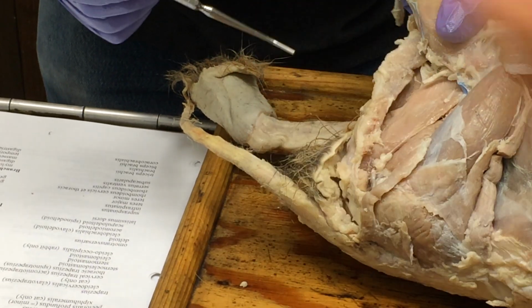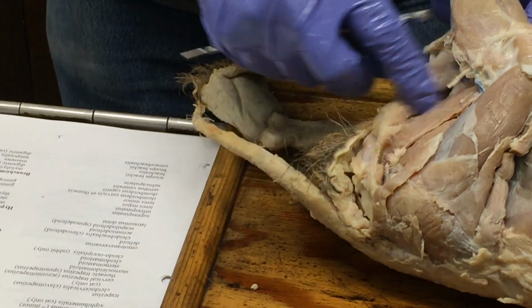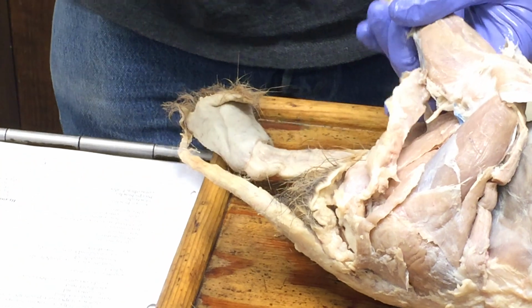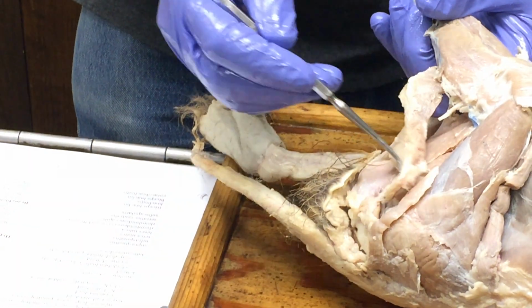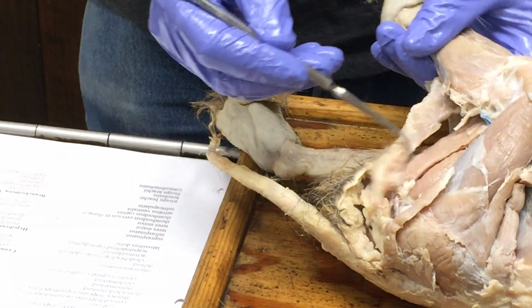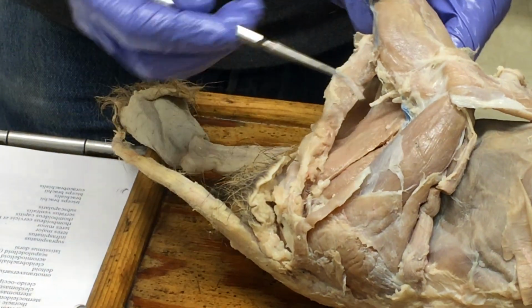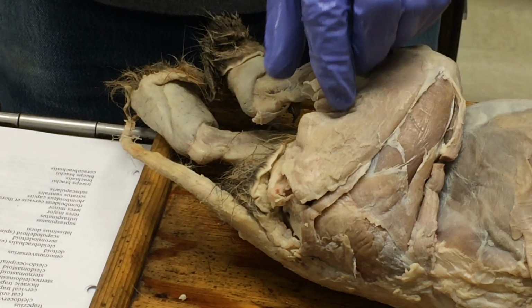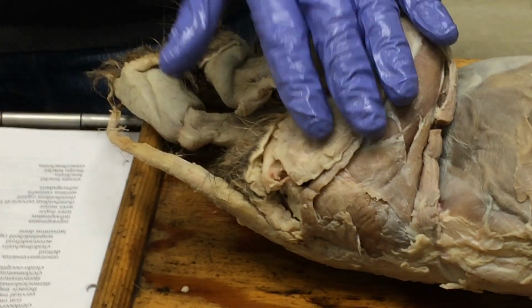I thought that was the semitendinosus and the, wait, semimembranosus was inside. No, you are right. I got myself confused. See, keep me honest. Thank you. This is the semitendinosus. It got torn up a little bit, and that's why I was confused. And this is the semimembranosus. Thank you. Semitendinosus, semimembranosus. Fix that, Jackie. Edit it out. Okay.